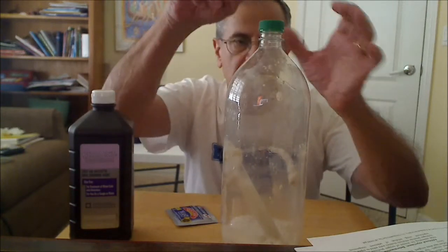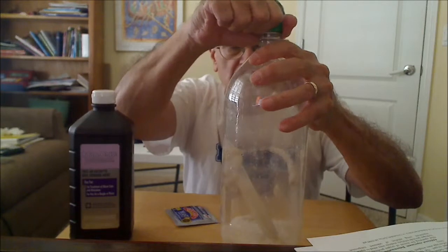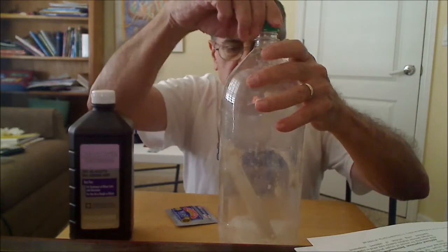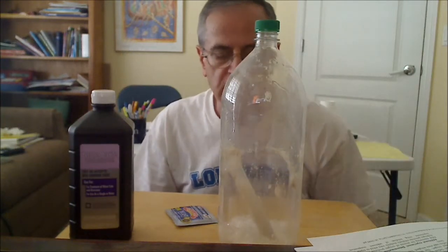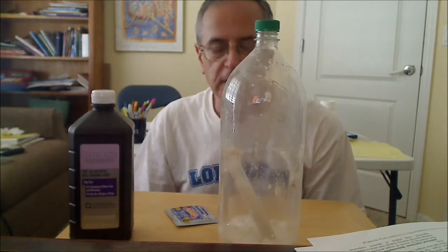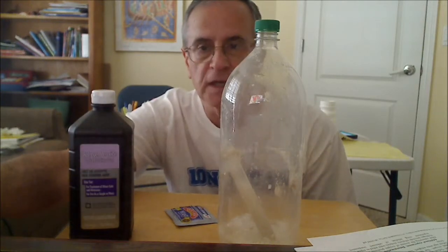You might tape it. And now I'm going to release, and I think you can hear the oxygen coming off. So I'm going to wait about 10-15 minutes and mass this bottle again, and then in a second video I will go through the calculation of determining the percent yield of the reaction.